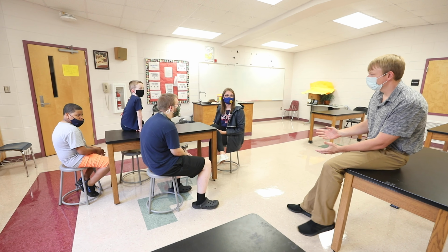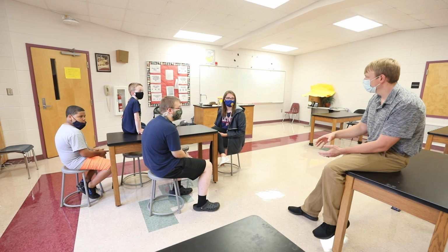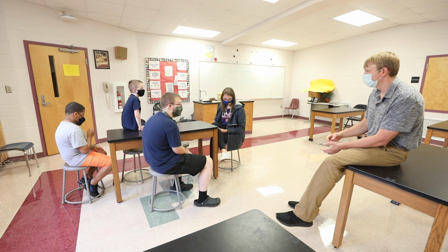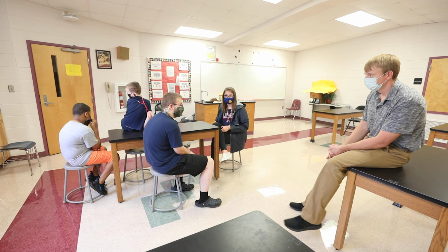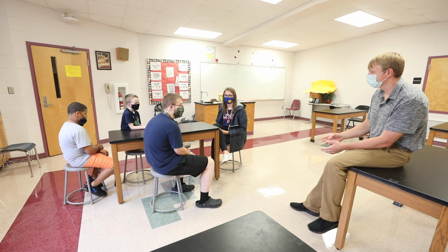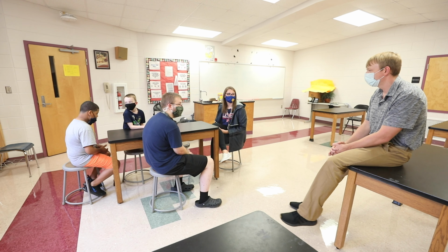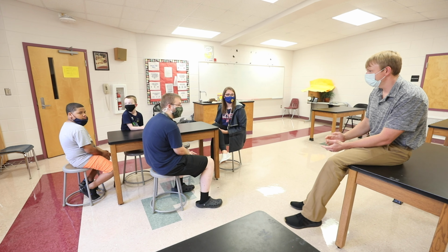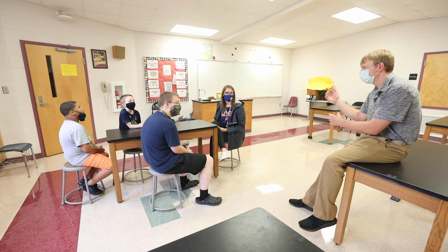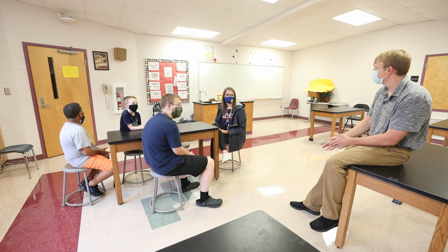Now, does that mean that there wasn't something floating in the air that could have fallen on it? You could still have stuff on your clean tray. Just because you cleaned the keys or the glasses or the computer or whatever, you should still have something on it because there's probably stuff floating around in the air that you just can't do anything about. But should you have as much growth on the clean tray as you had on the one that you didn't clean? No, you shouldn't have as much growth, right?